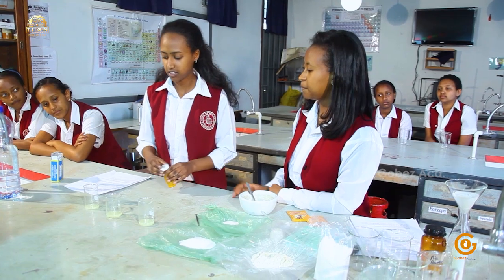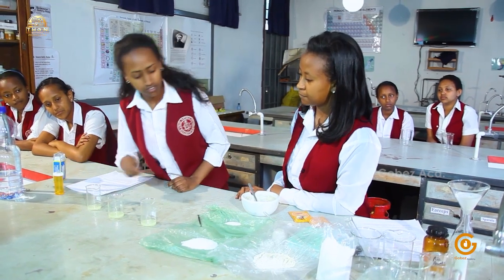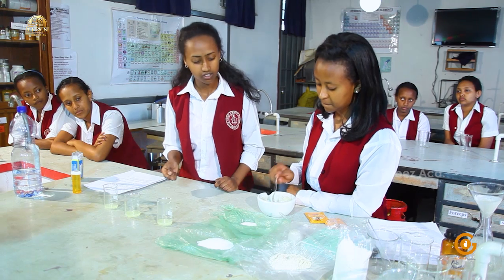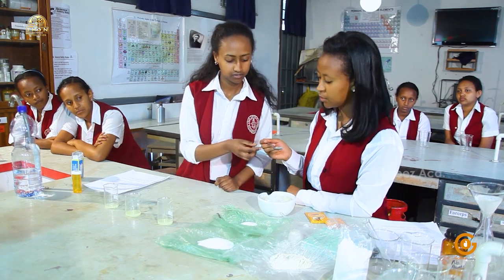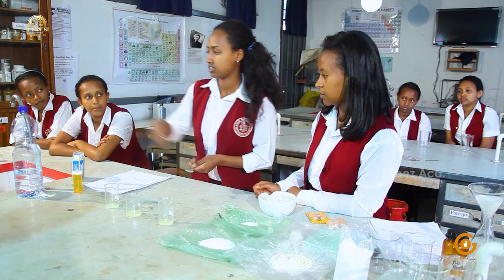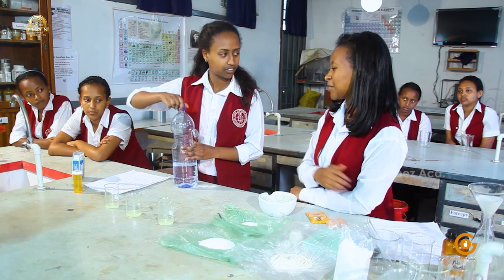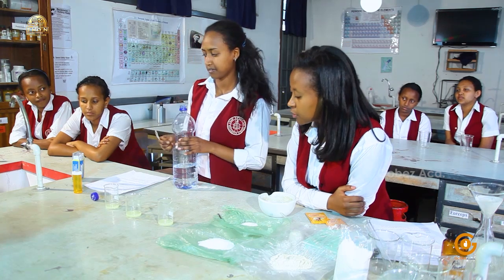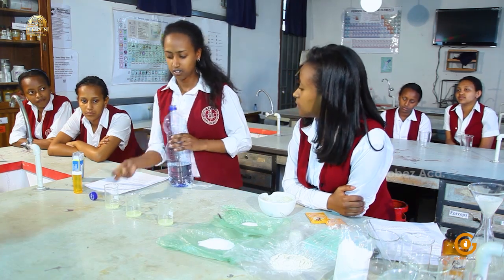Okay, before that, let's take out the seed. Can I have a spoon? I don't think it can help me. I think we need this to add a sugar in, so we need to wash the spoon. Okay. Maybe we can use a spatula. Okay, let's try.